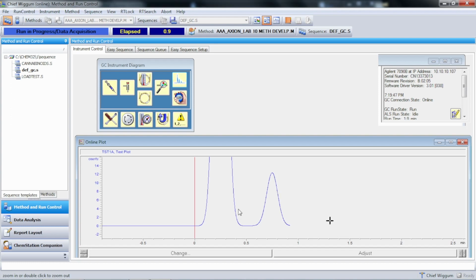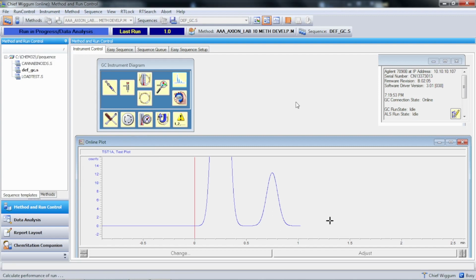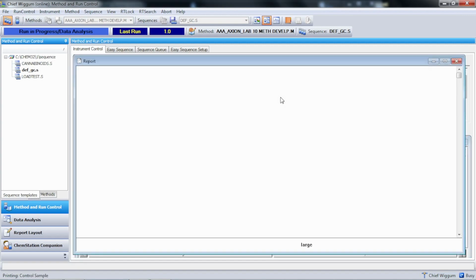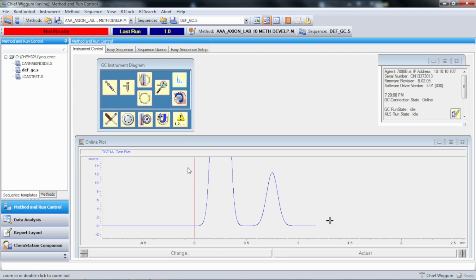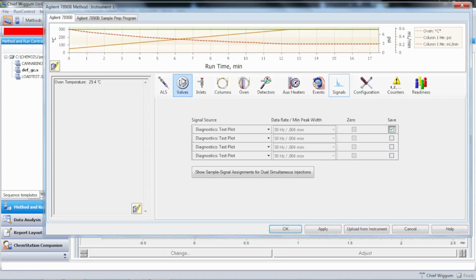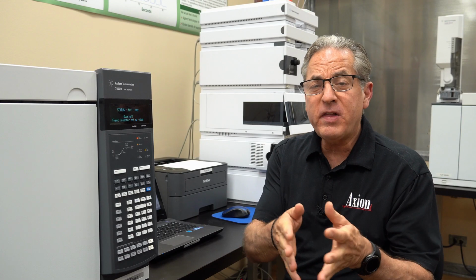So when you're done with that, make sure you remember to go in here and first we're going to go ahead and stop the run, and make sure you go in here and reset signal 1 to the FID, and don't leave it as the test plot, because it's a sort of nasty practical joke you could play on somebody. If you set the signal 1 to test plot, then no matter what they inject from now until the end of time, they'll get the same 3 peaks. So make sure you reset it to the front signal FID, and then you will be ready to do good chromatography. So hopefully that helps.